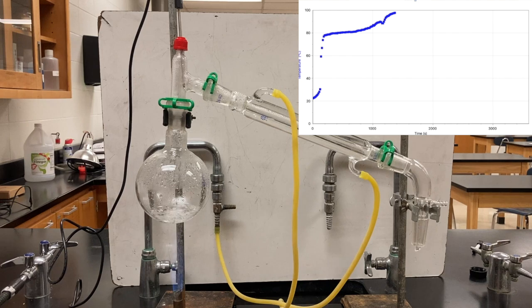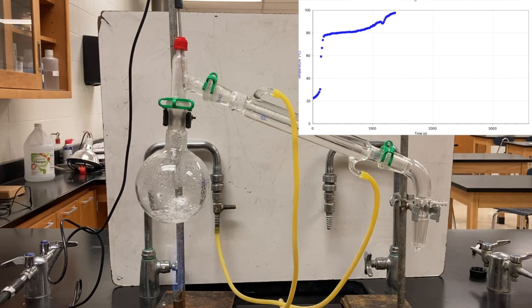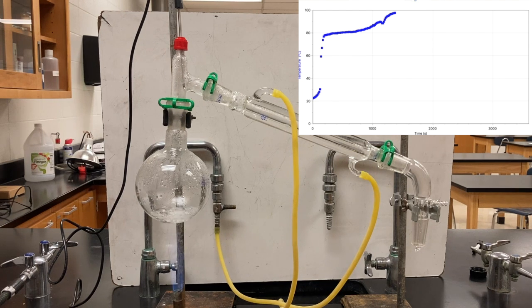The temperature continues to rise as it continues to boil here. And again, we're starting to see it gradually achieve another flat spot on the graph. Again, you can't see it, it's off the screen, but there's a beaker catching what's dripping out of the condenser right now.